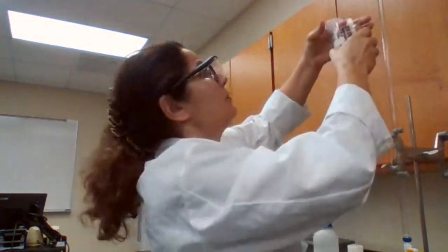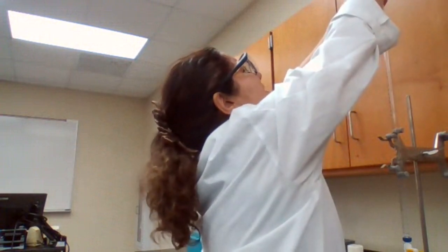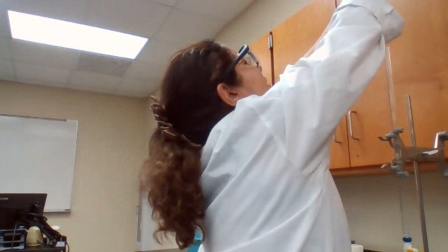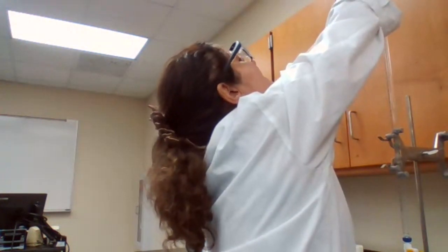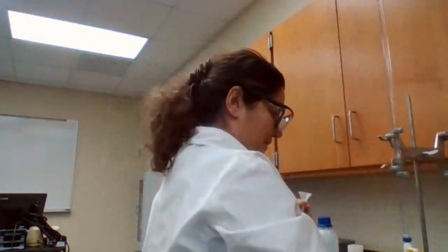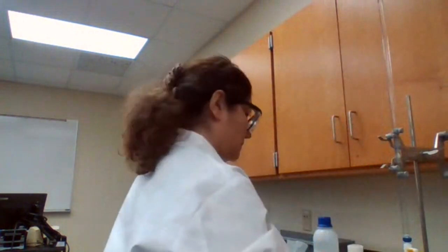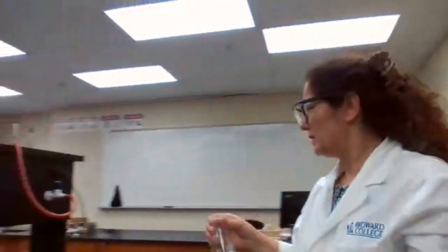Usually when it's a group of students working here, I tell one person to be responsible for the flask, one for the burette, but now I have to talk to myself and say, get the burette ready and get the flask ready, everything ready. Okay. So I have my burette filled up, but it's not adjusted to 0.0 exactly. Measuring mass for flask.